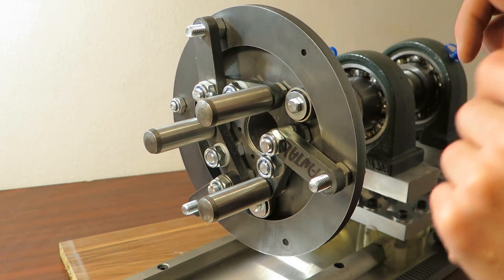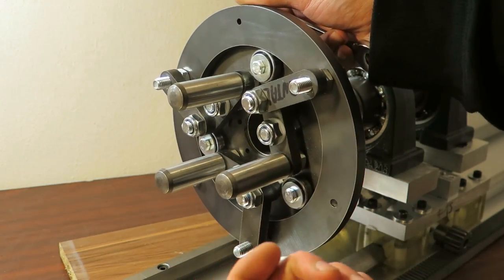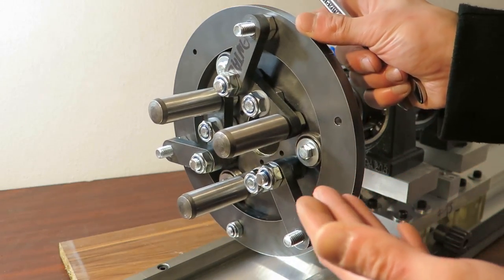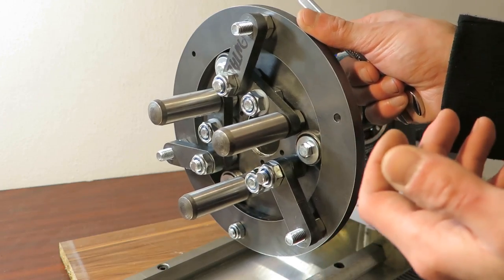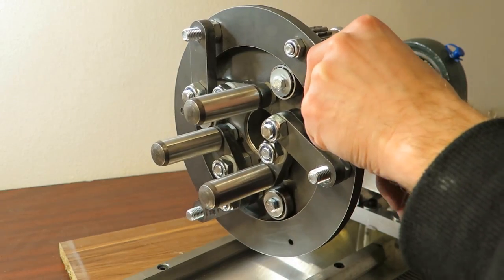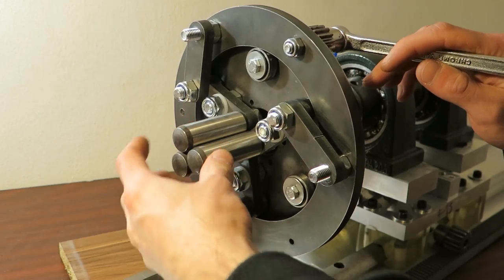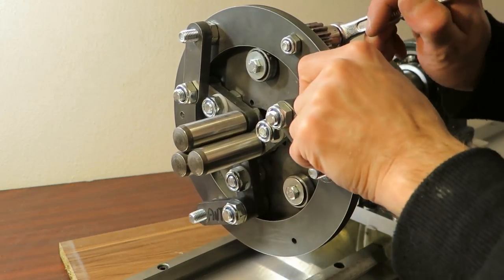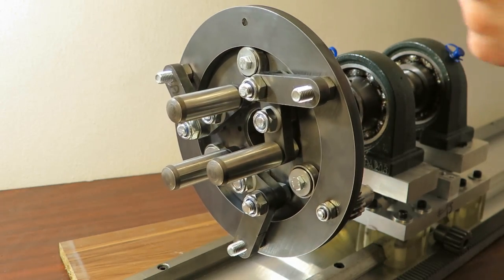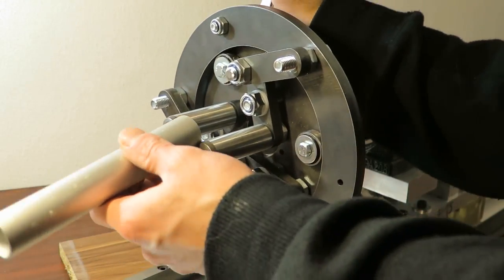At first, I was quite skeptical because, well, you see, I am using regular bolts and locking nuts. The problem with bolts and nuts is that they are not perfectly straight, and what I expected to happen is that when I close this, there will be play basically there. But it seems that there isn't any noticeable, at least. Let me grab something here and let's try this.